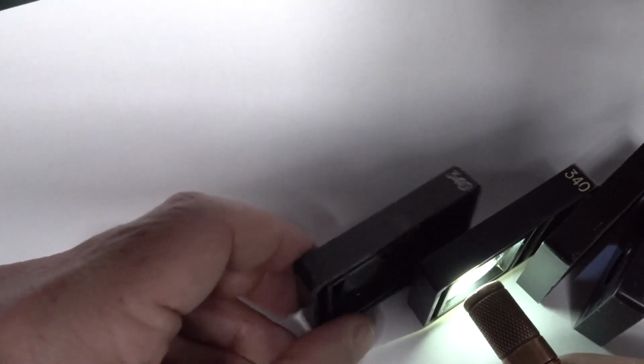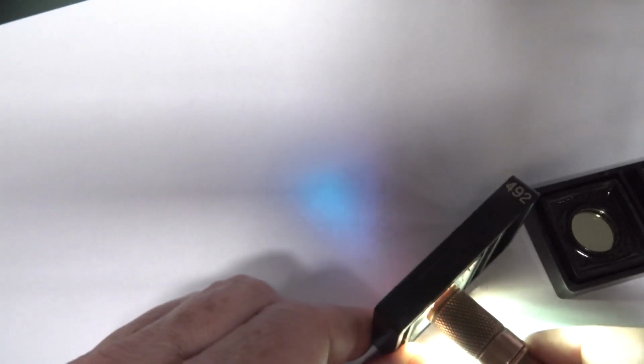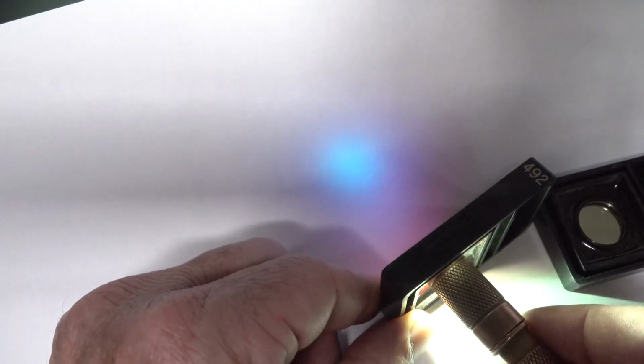I'm not entirely sure. But anyway, 340, we're not going to see that. Oh, I've got two 340s. So 405 and 340, it doesn't get through at all. But 405 certainly gets through. And 510. Isn't that fascinating? I like it. What is your favorite color? That one's really attenuating a lot. Has that got the biggest attenuation, the 492?